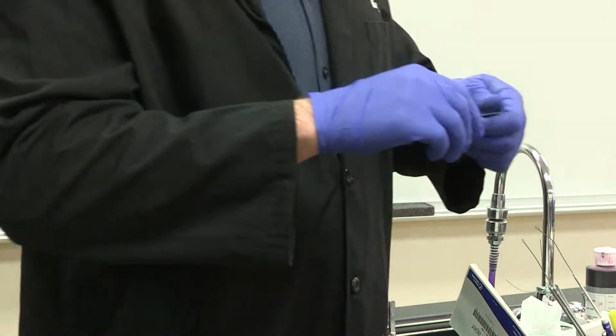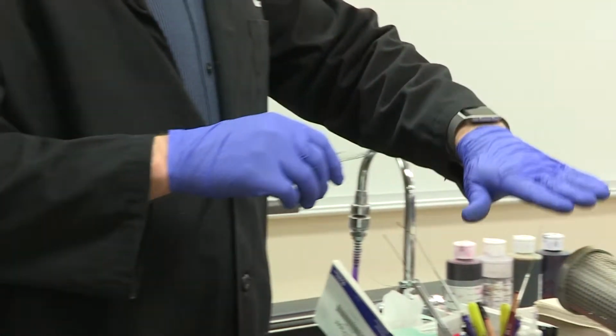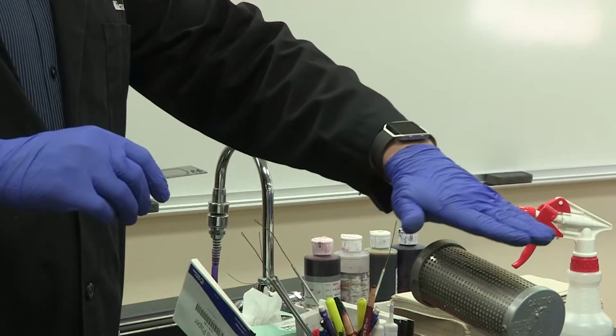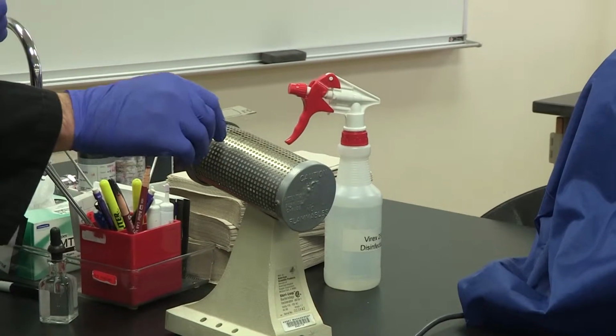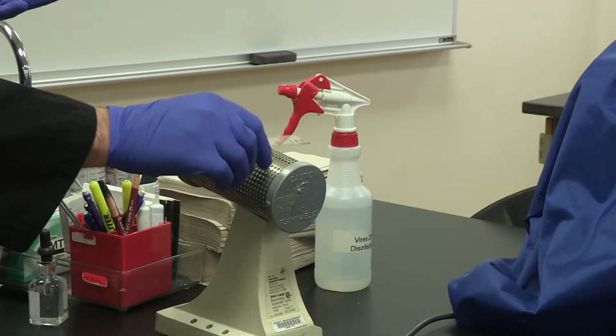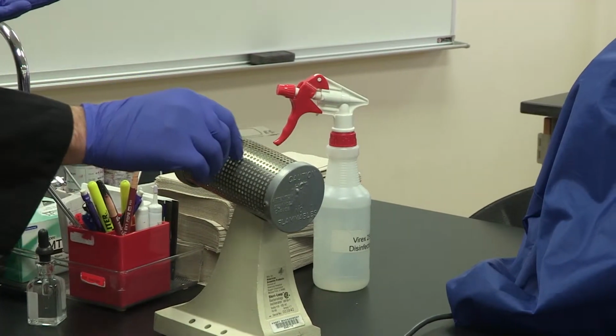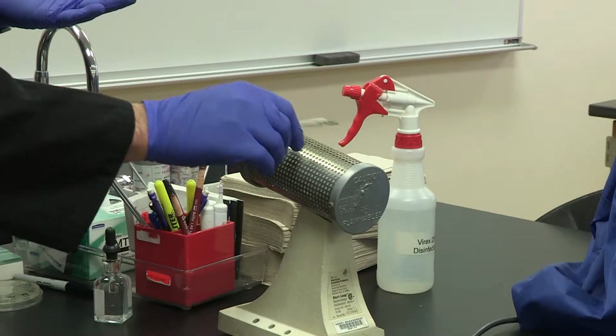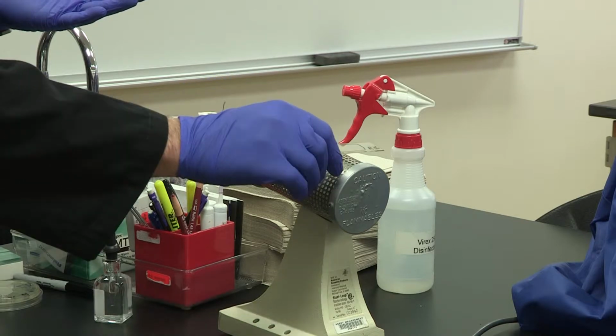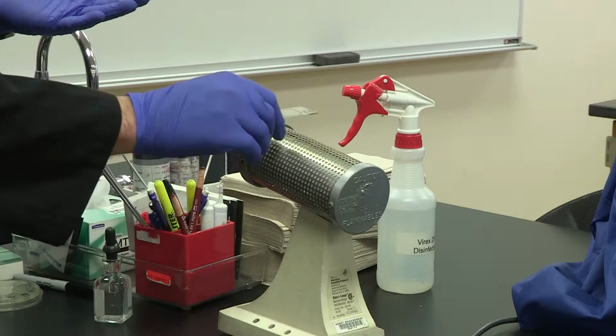Okay? Once it's nice and dry, and again, you want to be completely dry, is the heat fix step. Once you have it nice and dry, you have this incinerator that's nice and hot in front of you. What you can do here is wave it about an inch away from the incinerator for about 15 to 20 seconds. Now, please note that your fingers are a very good indicator of temperature. If your fingers are burning, so are the bacteria.